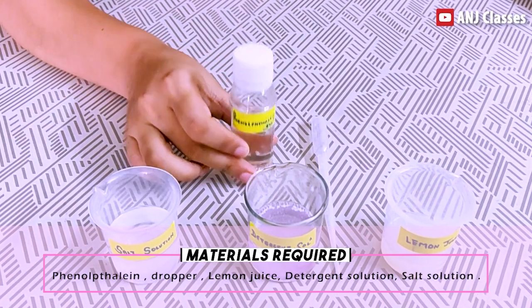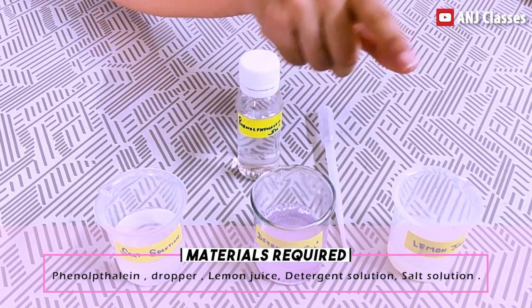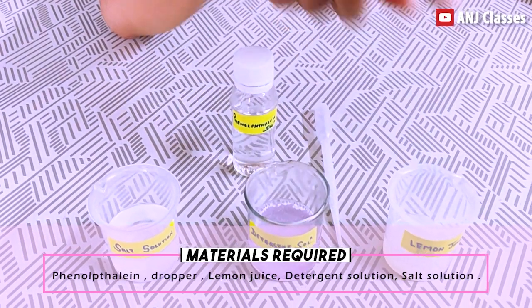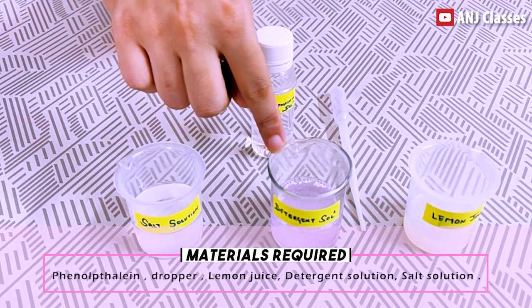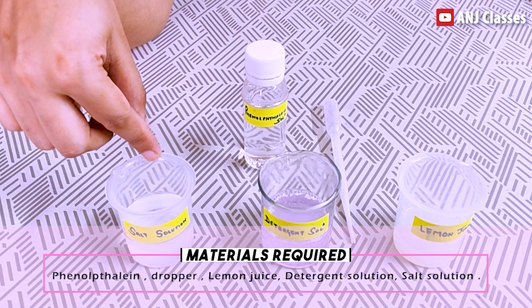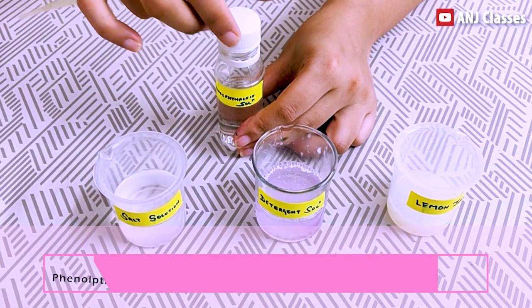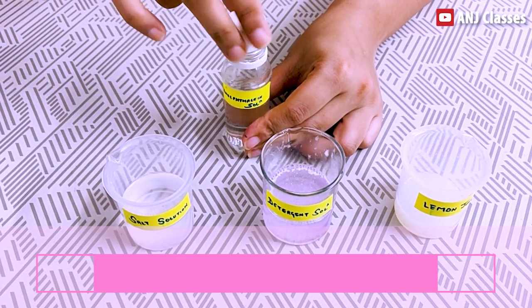Materials required for this activity are phenolphthalein solution, dropper, lemon juice as acid, detergent solution as base, and salt solution as neutral solution.